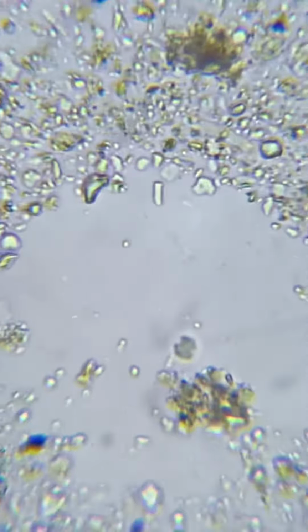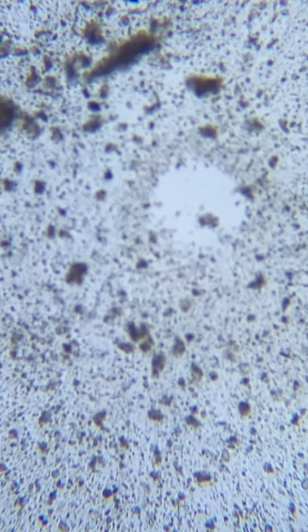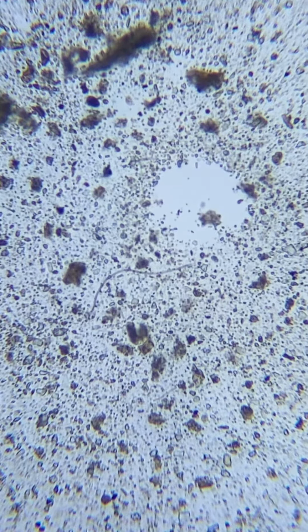But I just wanted to give you an idea of how to find these guys when they're tiny, is just look for order in the middle of chaos. There you have it. I'll get a picture of that fungi right below.